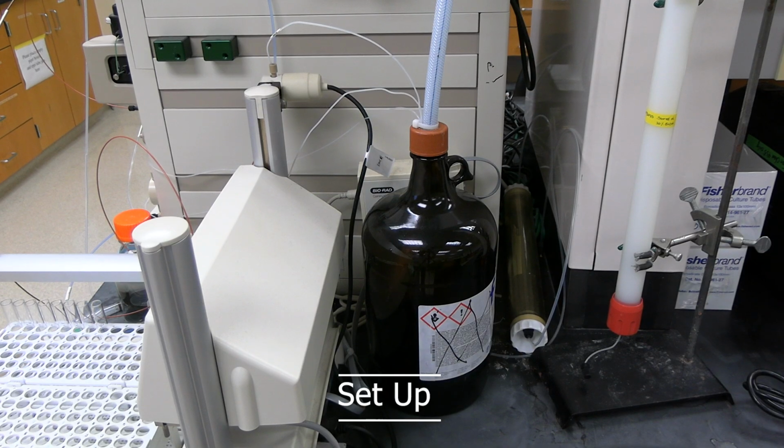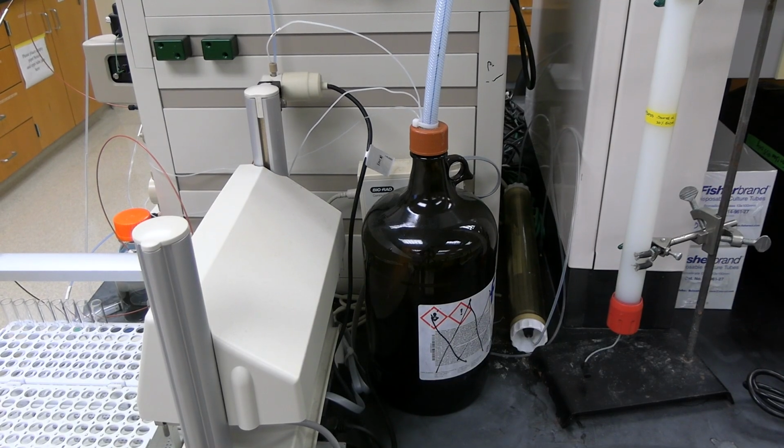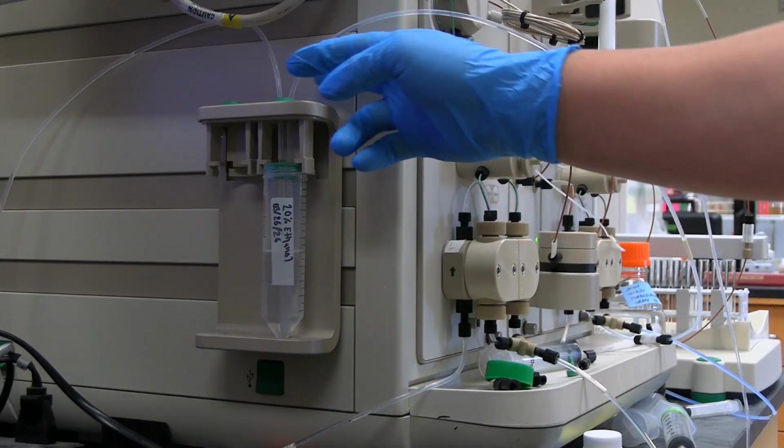Setup. Check the instrument waste reservoir. If the waste is greater than 75% full, replace the waste container. Check the rear seal wash reservoirs, and if needed, change the reservoir solution.